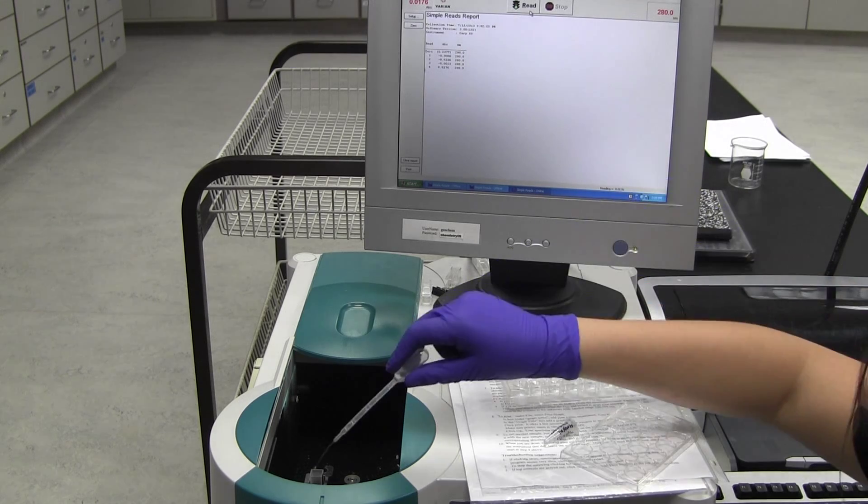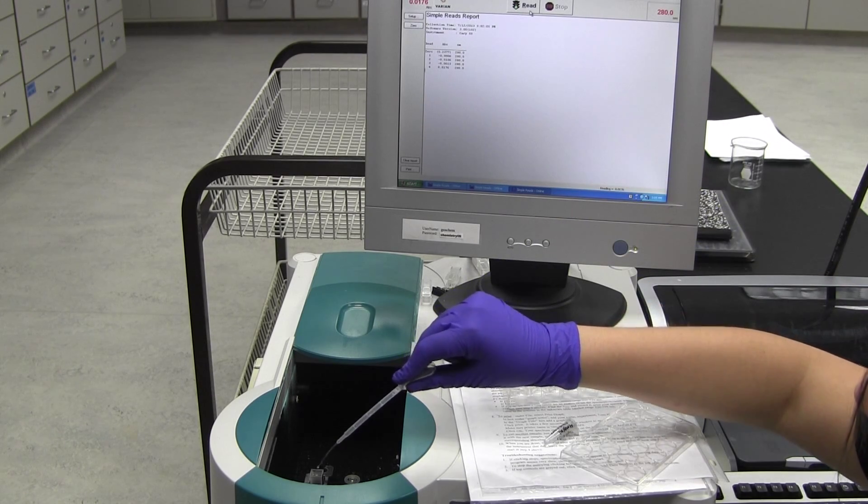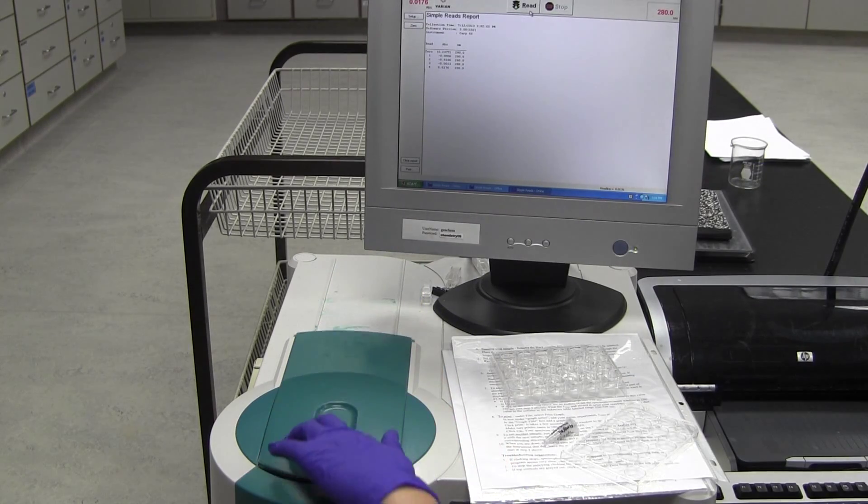When you have finished running your fractions, print your results. Make sure to choose the correct printer, do not choose the PDF creator.